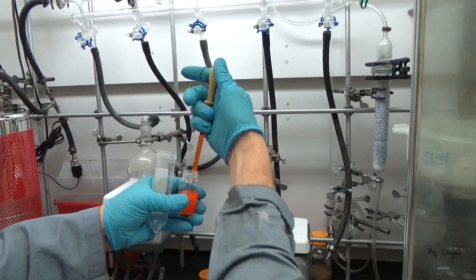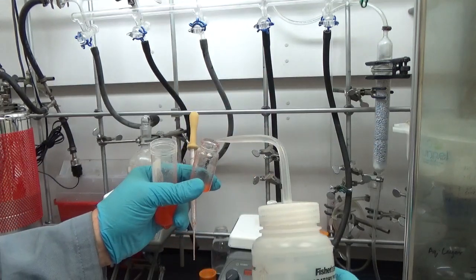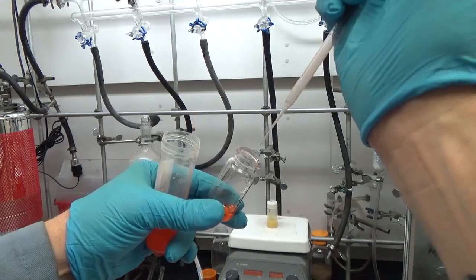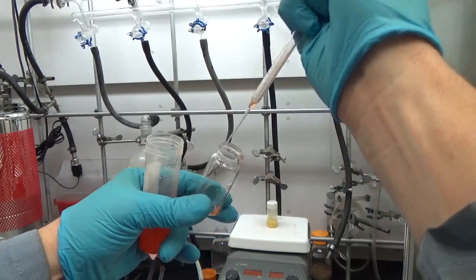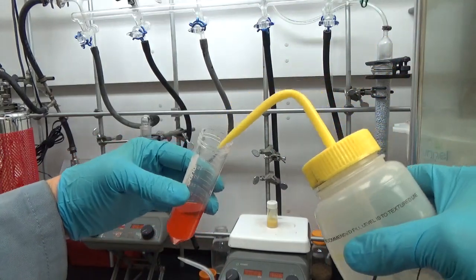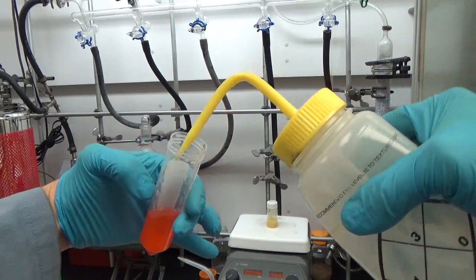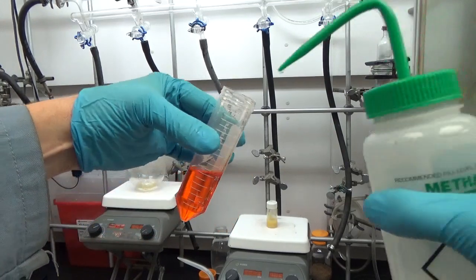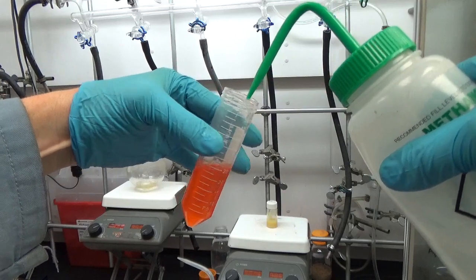Here are the cores. We have a video on making the cores, and we're going to process them by size-selective precipitation. You can see that the cores were partially solidified, so we have to either heat gun it or just use extra solvents. We're pouring that into a falcon tube. We've gotten it into the tube, now we're adding some isopropanol.